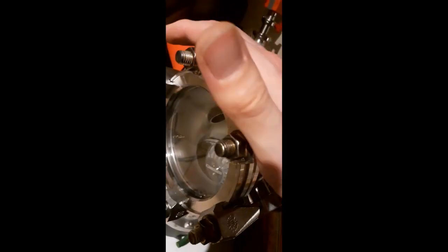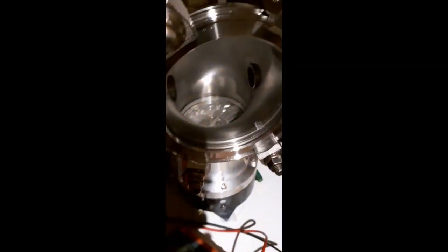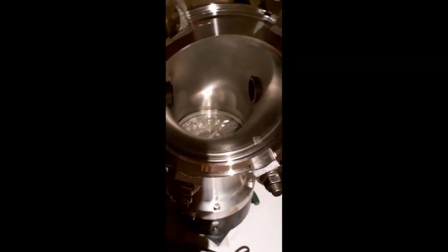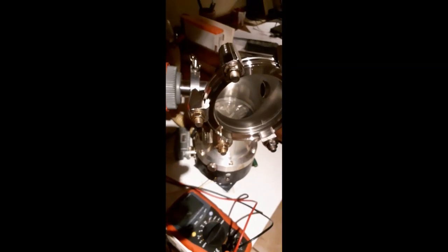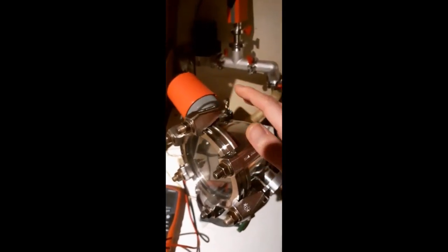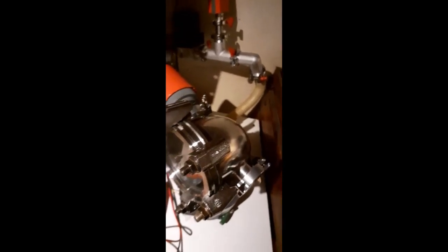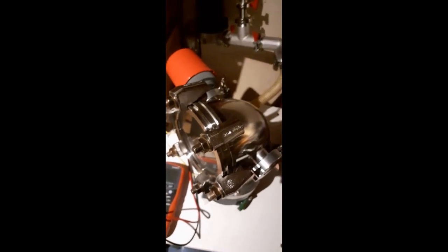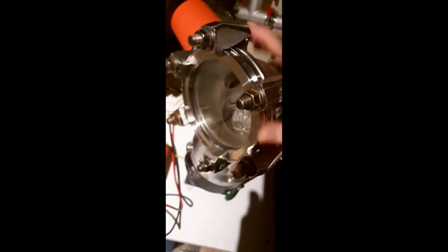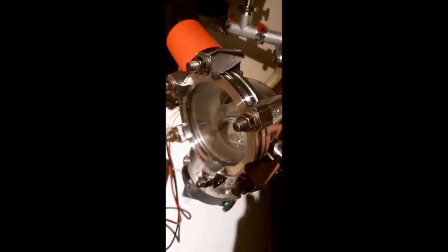Now, what to use this for? Well, I don't really have an application that needs it right now. It would be nice to try and do some sputtering, maybe. Or maybe some plasma studies or something. There's a lot of things you can do. The problem is, if you have a really nice vacuum chamber that just has the rotary vane pump, you can always just put in a marshmallow and watch it explode or do something else. But this setup is so fragile that you can't really use it for shenanigans like that. It's too good. It's too nice.